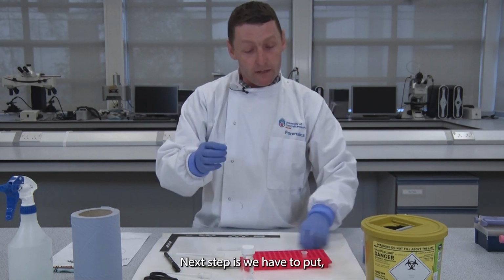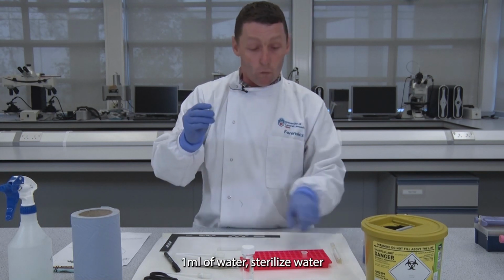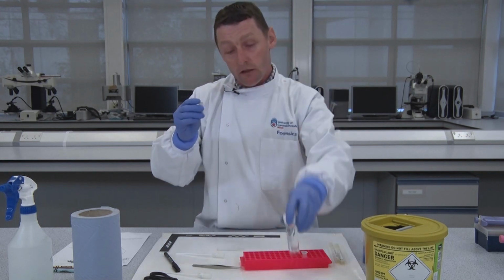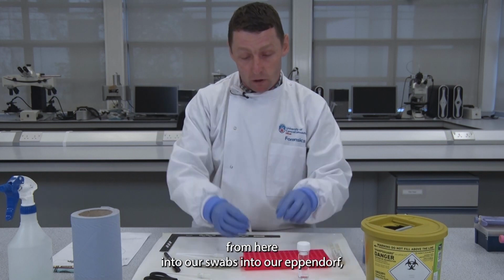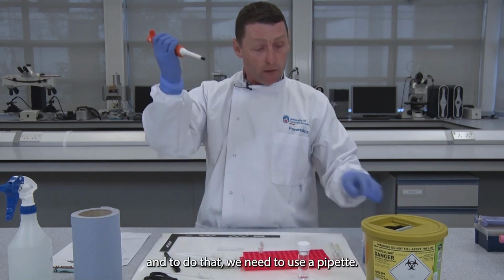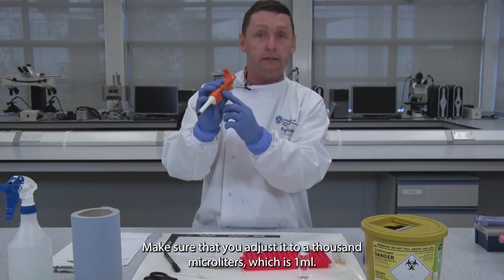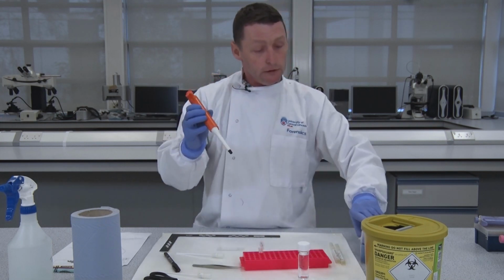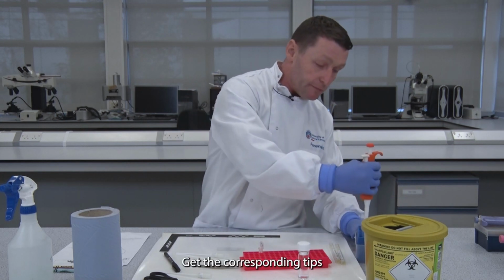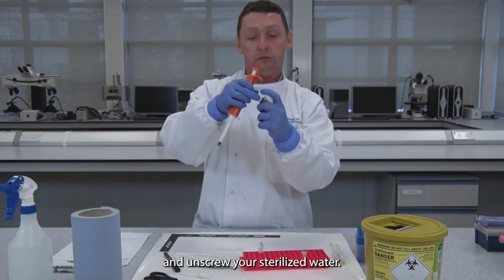So that's great. Next step is we have to put 1 mil of sterilised water from here into our swabs in our Eppendorf. And to do that we need to use a pipette. Make sure that you adjust it to 1,000 microlitres, which is 1 mil. Get the corresponding tips and unscrew your sterilised water.